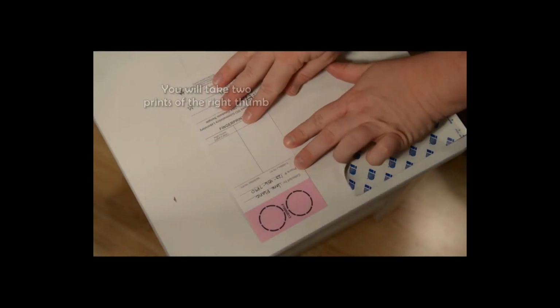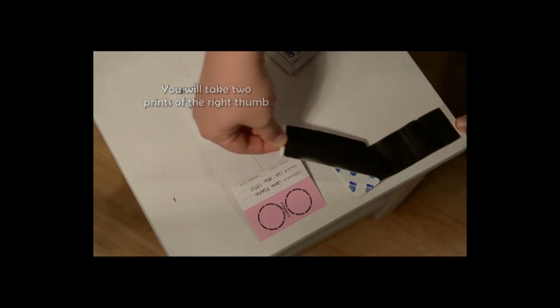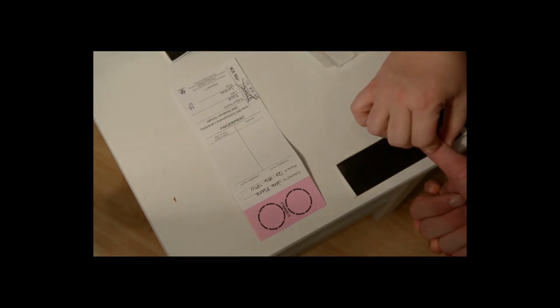Once all the necessary documentation has been made, you are ready to move on to fingerprinting. Space for 2 right thumb fingerprints are provided on the back side of the DNA sample card. Expose the black ink provided to collect 2 prints. For your convenience, a moistened wipe is also included for cleanup.